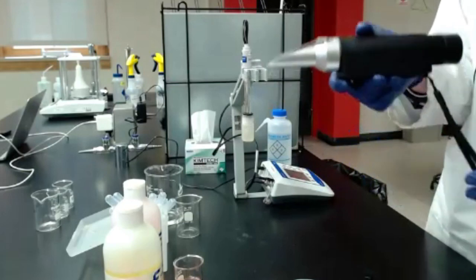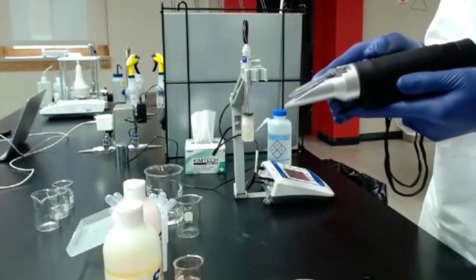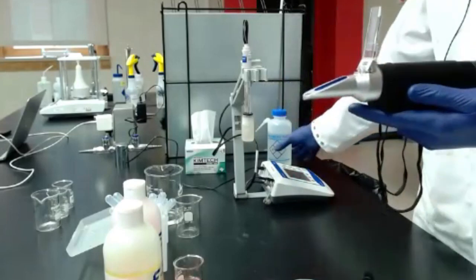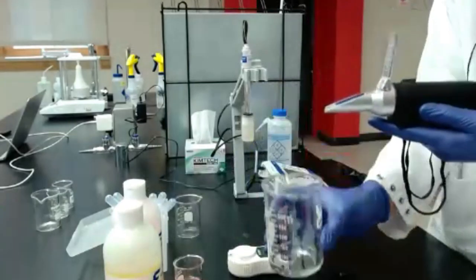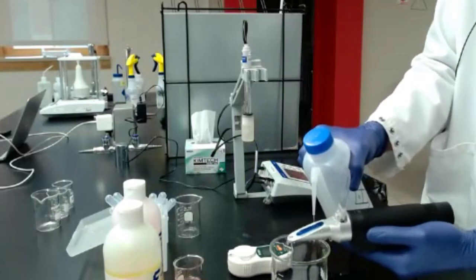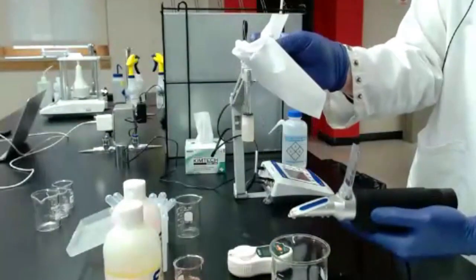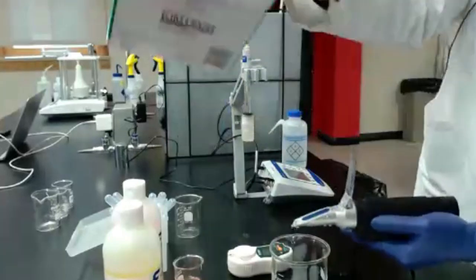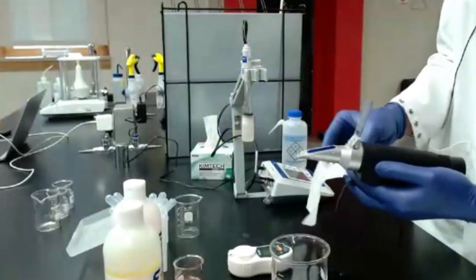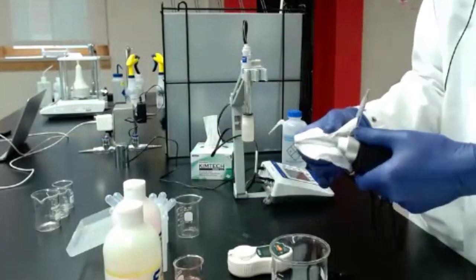So is anyone using a manual refractometer today? I saw in our pre-workshop survey, it looked like a lot of people had them and they're familiar with them. But I'm going to go through it a little bit just so that we get best practices down. So I'm going to start. I'm going to open my lens cap, get my little waste bottle here, and just give my lens a rinse. It's been in the drawer for a few days, maybe there's some dust on it. Rinse it off with my DI water, and then using my Kim wipes. If you have Kim wipes, you can order those online somewhere, or a soft lint-free cloth. Dry that off, make sure it's nice and dry and clean.